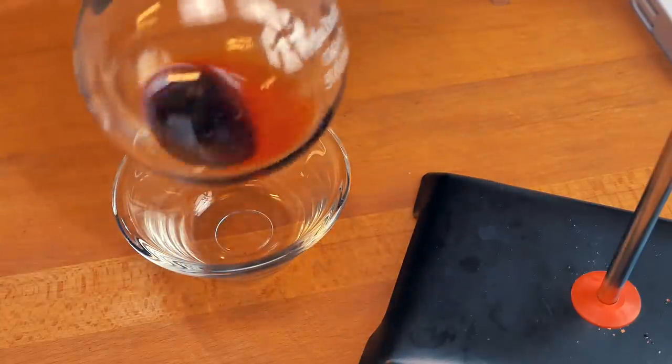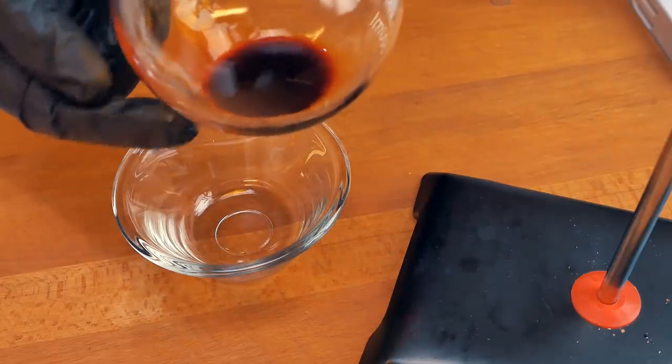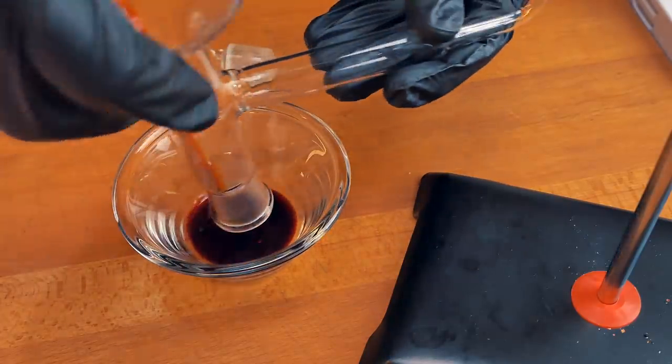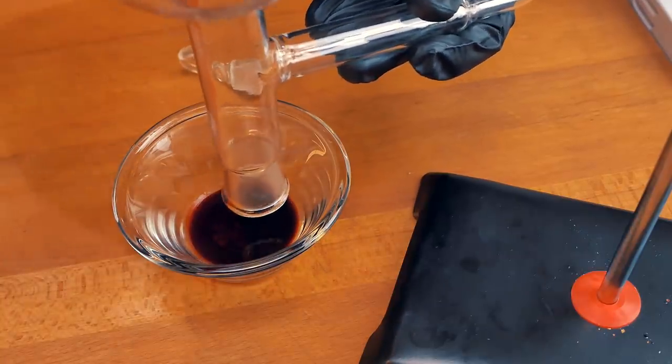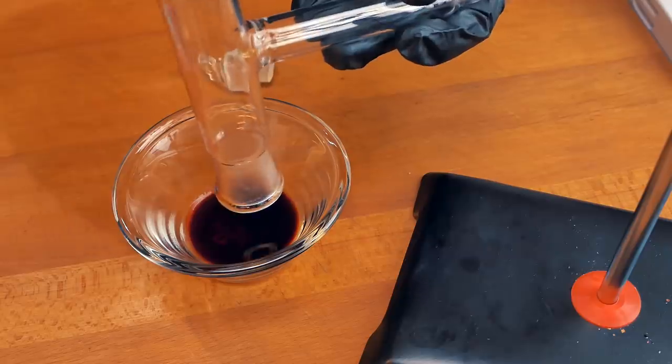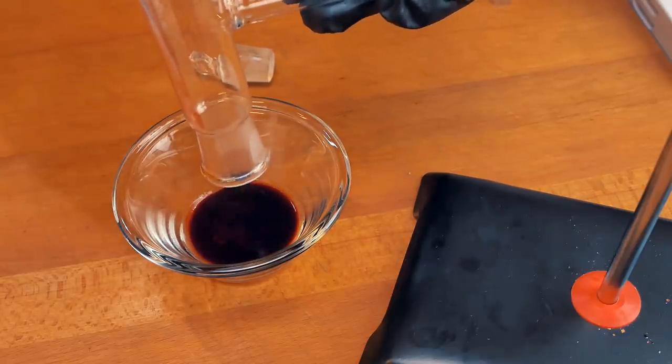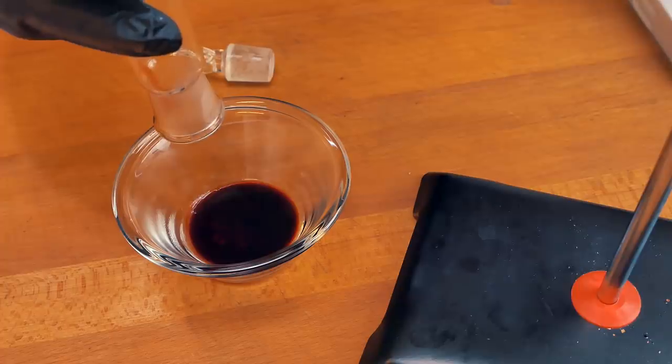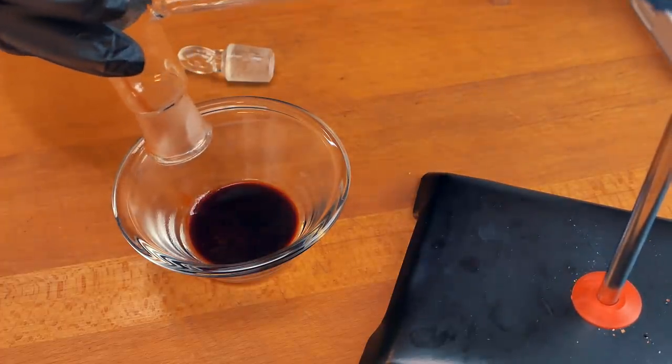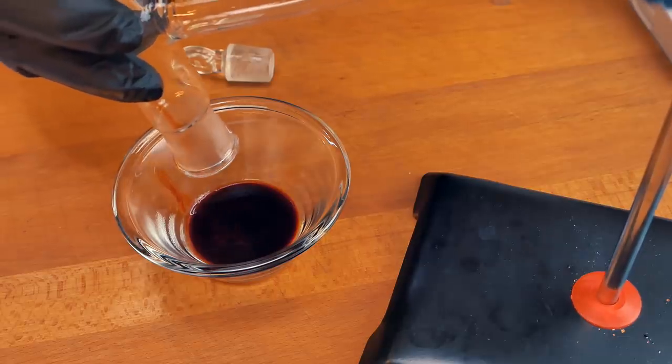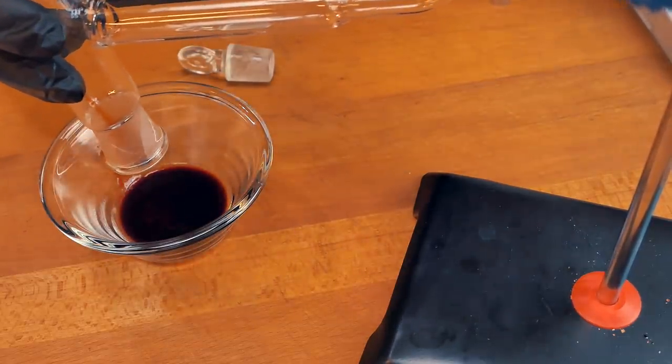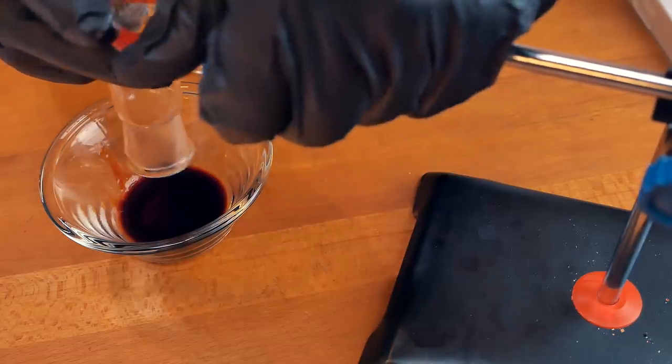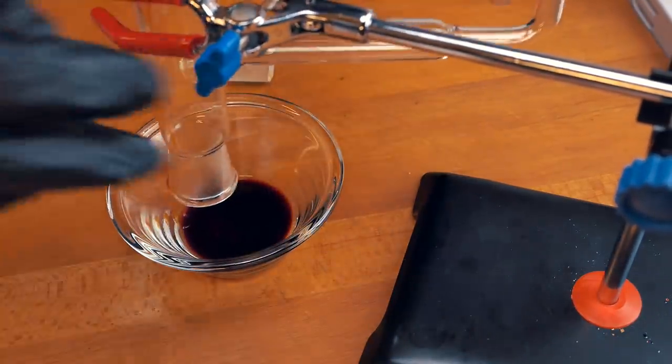So there we have our capsaicin, which has still got a little bit of the ethanol in there, but that's pretty concentrated. Wow, those smells. Oh, wow. That's pretty strong. Whew. It's not a completely unpleasant smell, but it's really difficult to describe. I'm just going to let this drip out so we can get as much of the capsaicin out of here as we can.